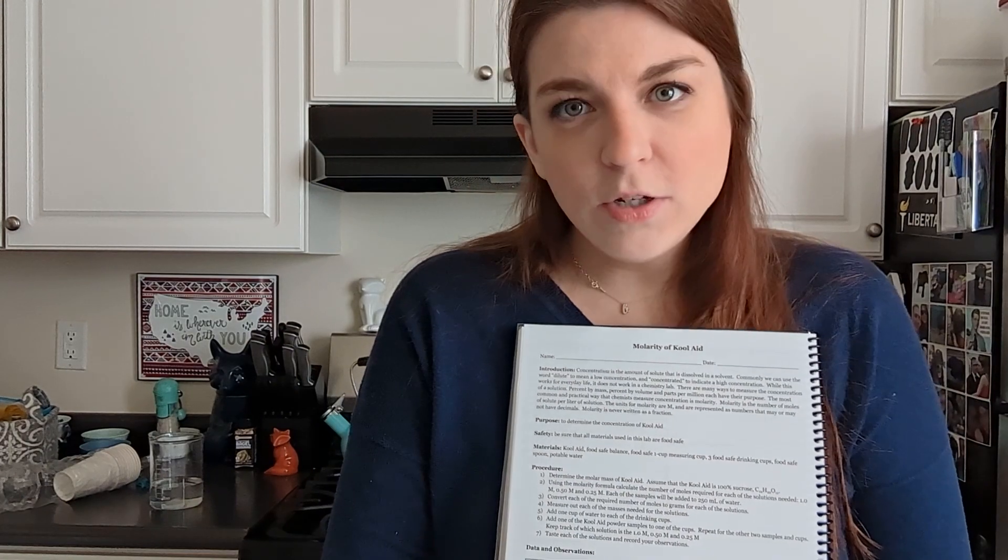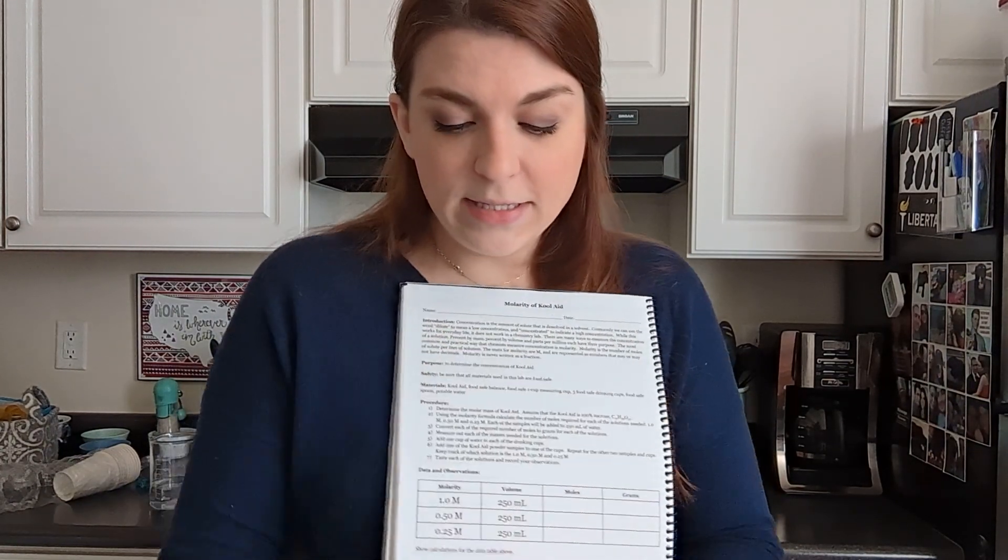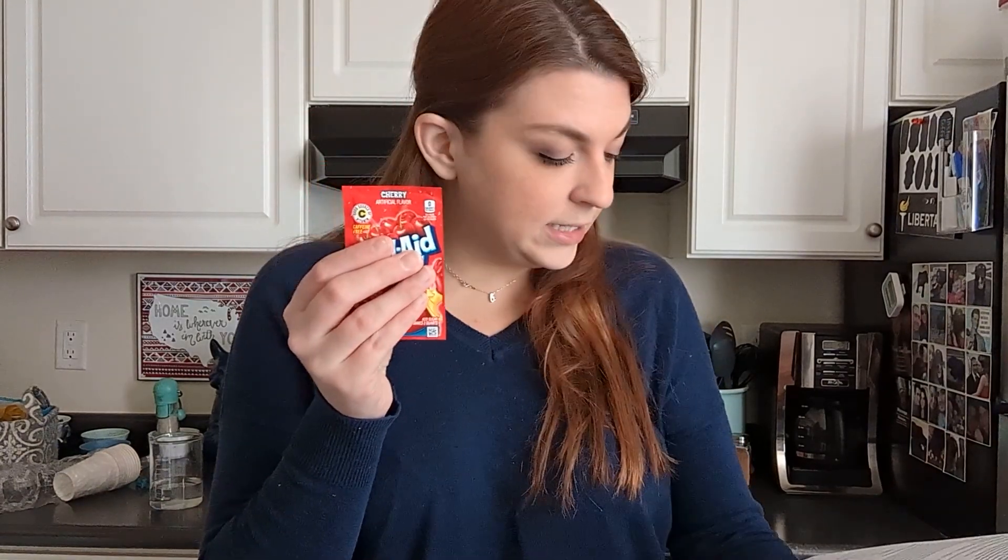The best way to do this is probably with a big tub of Kool-Aid powder, because it's sort of what this lab is designed for with the measurements that are given. I'm going to downsize this and just use two packets of Kool-Aid just because I don't drink this stuff, I don't want it in the house, and I currently don't have in-person students to teach. So we are just going to downsize this.